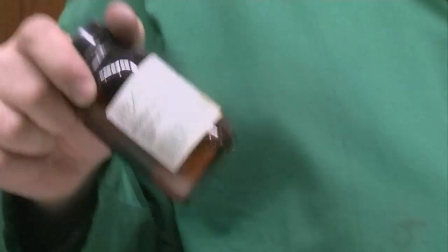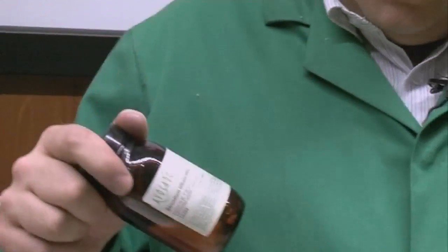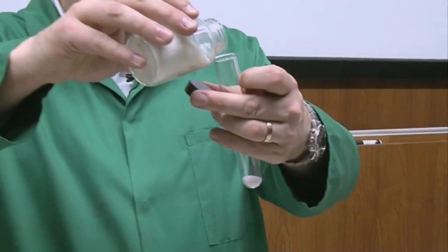So we need to take some strontium ions - in this case I've got a small amount of strontium nitrate. I'm going to take a small amount and put it into a test tube. Now we take our excitement mixture and give it a bit of a shake, mix it all up. So all of those metal ions are mixed into all of that nice source of carbon and energy.